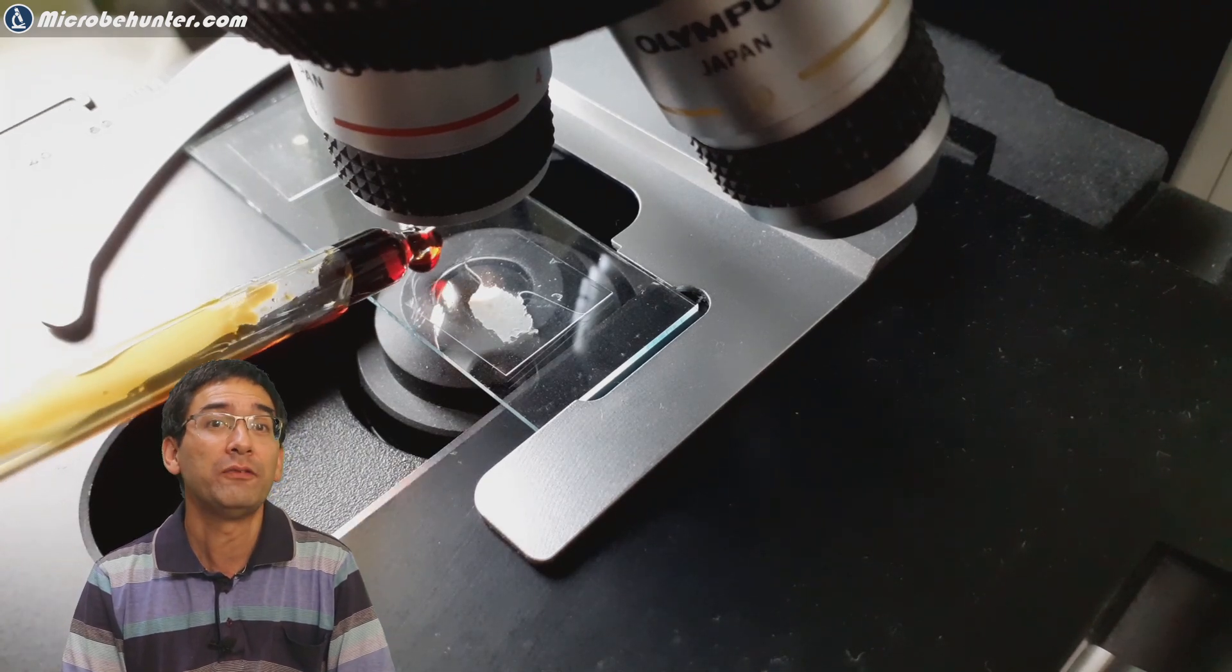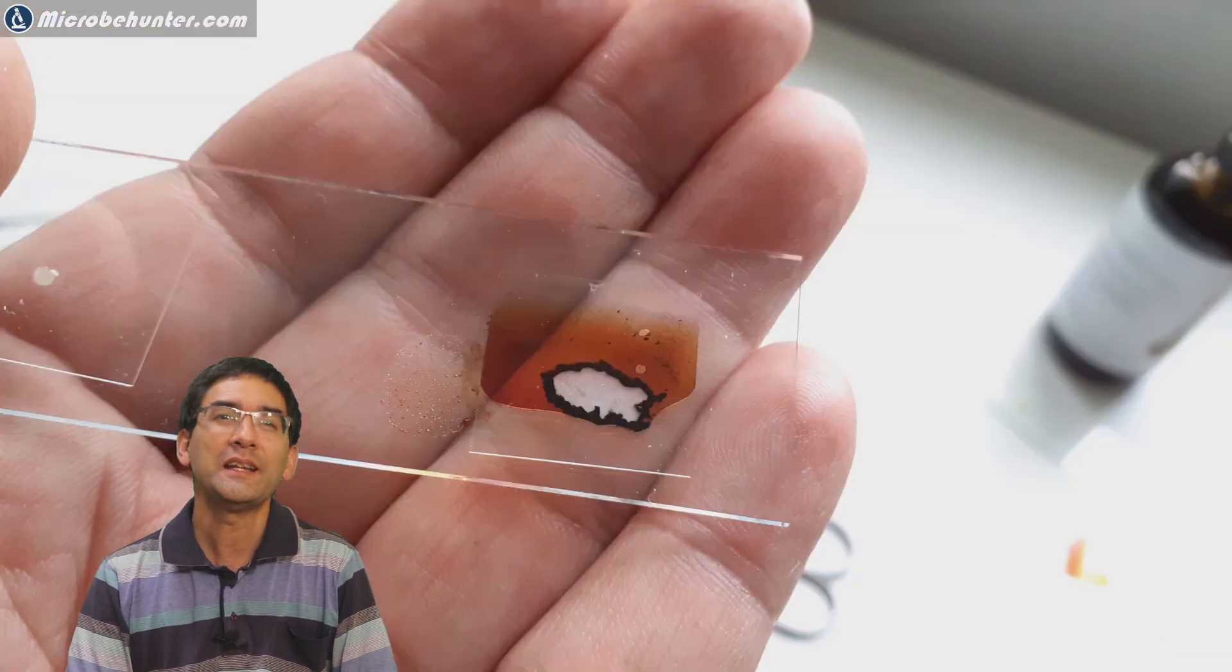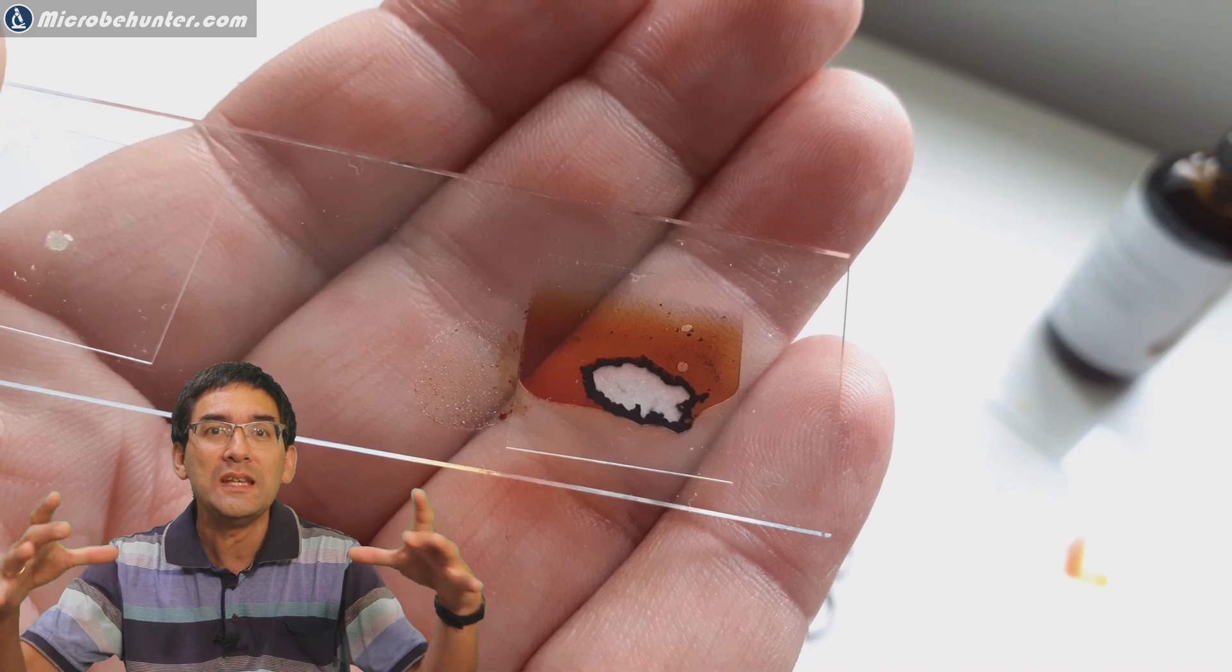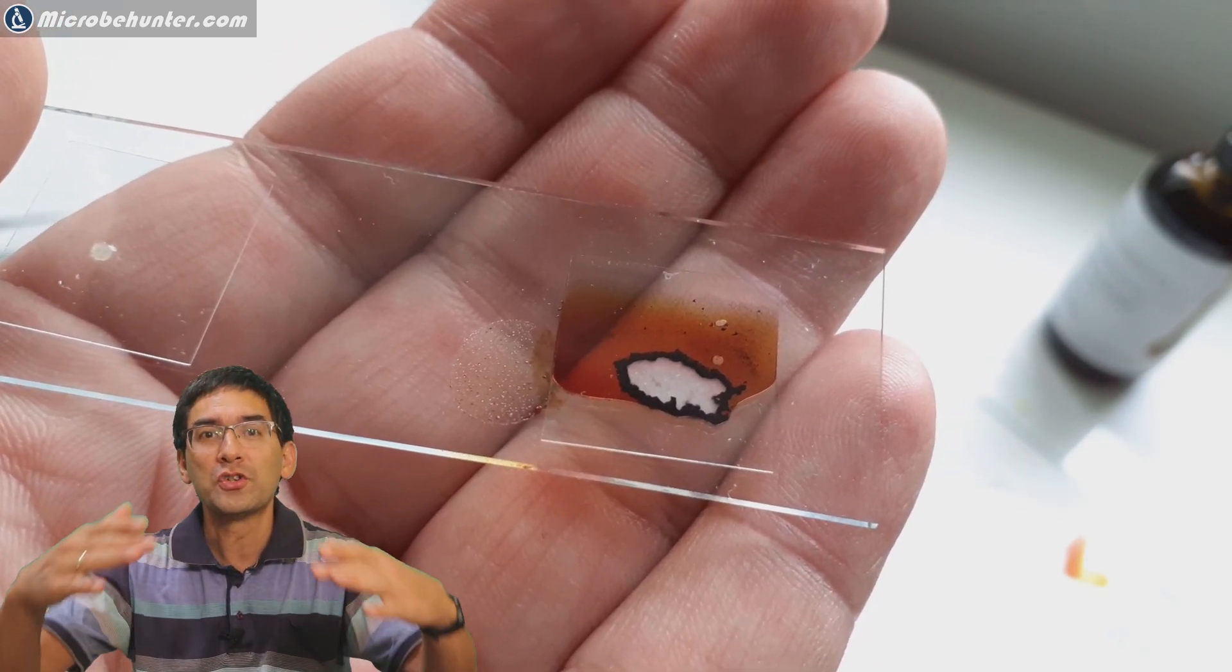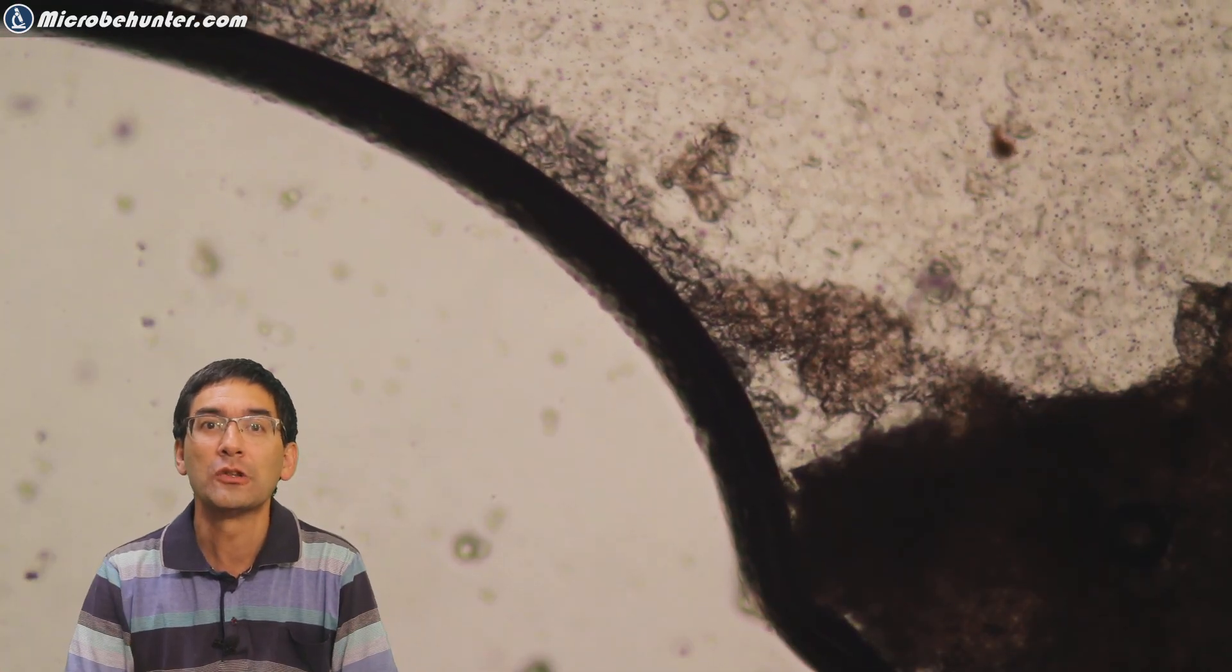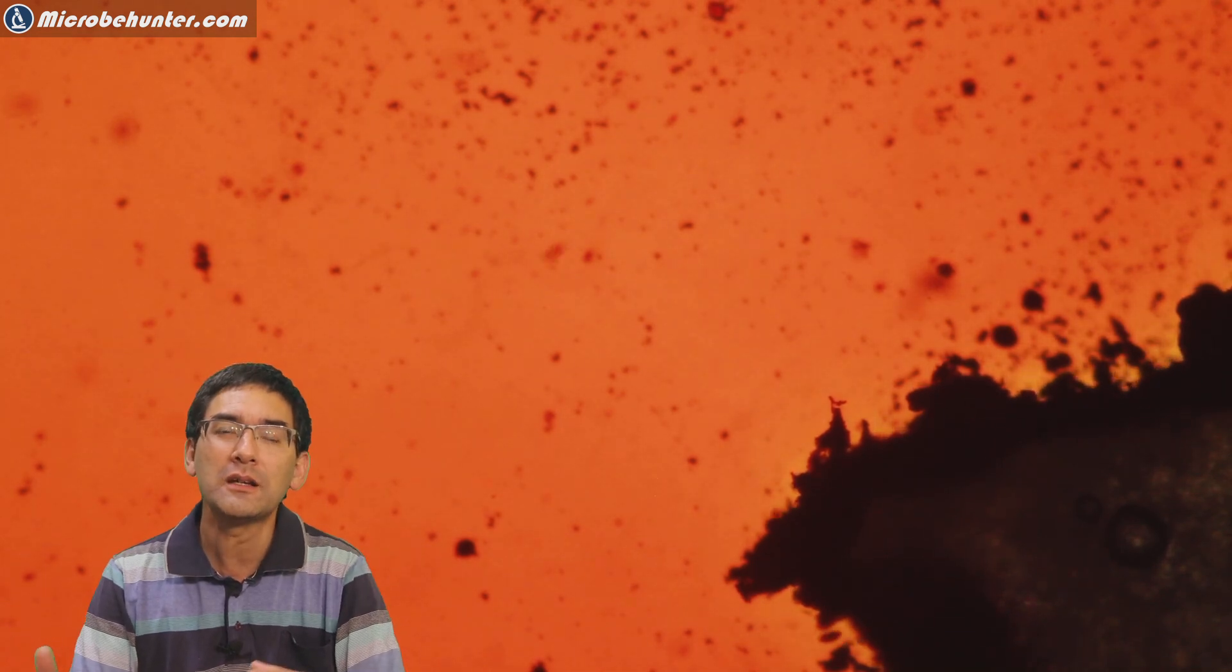Please be careful when you do this yourself - iodine is quite corrosive and when it touches the microscope parts it can actually damage them. What you can see is that as the iodine soaks into the bread, it starts to color those parts black where there is starch. Because there's lots of starch inside the bun, it immediately colors black.